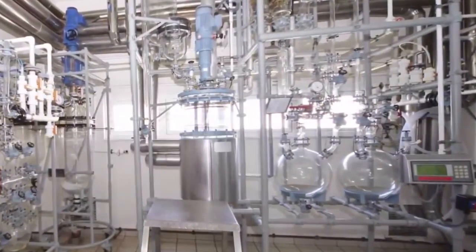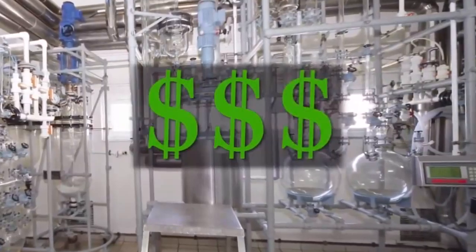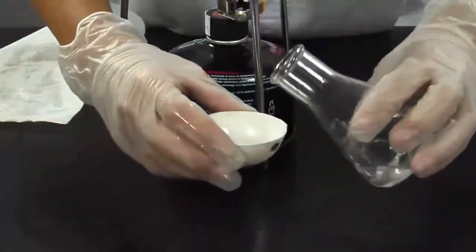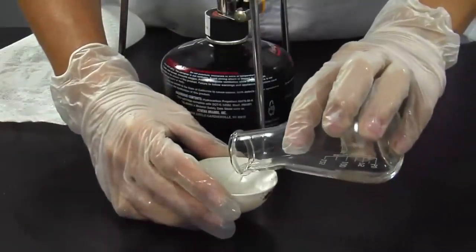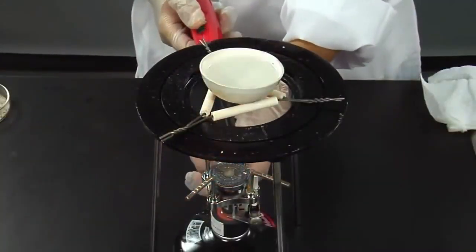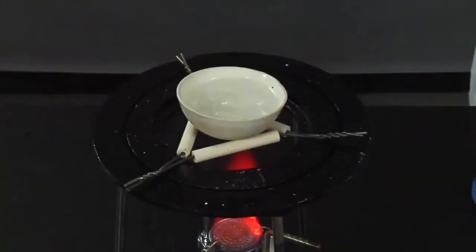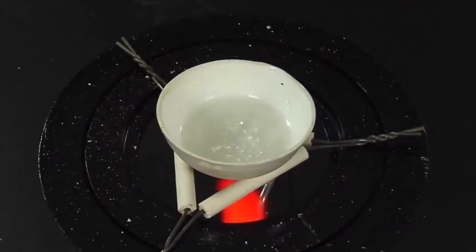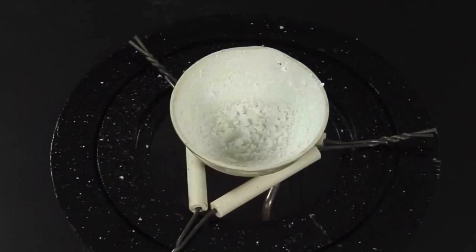Some countries that have very little freshwater resources have to use this process to get their freshwater supply. The method is expensive as it consumes large amounts of energy to heat the water to its evaporating point. Since we only wish to remove the salt, we will use an evaporating dish. The salt has been recrystallized and the water has evaporated.